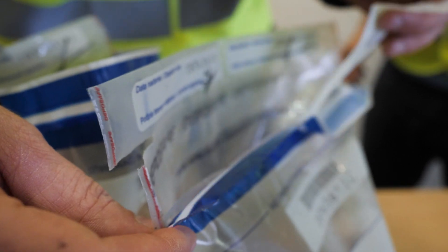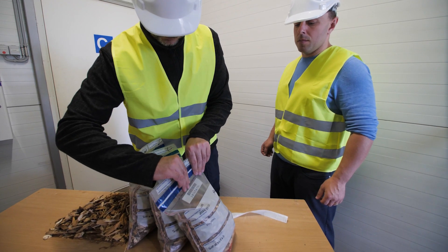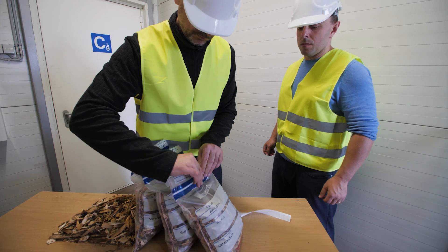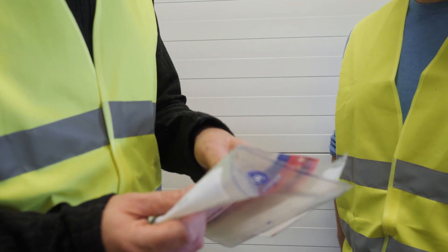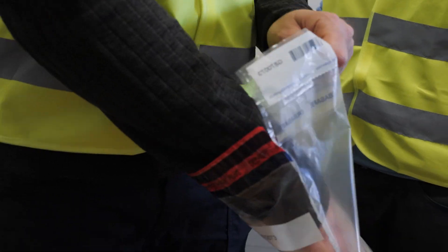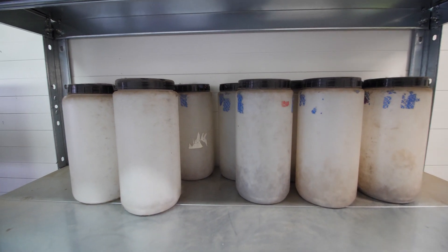Sampling bags are the most convenient and cheapest storage containers. They are hermetic and can be sealed only once. The seller must be ready to provide its sampling bag if the buyer so requests. Hermetic containers or other items may also be used.